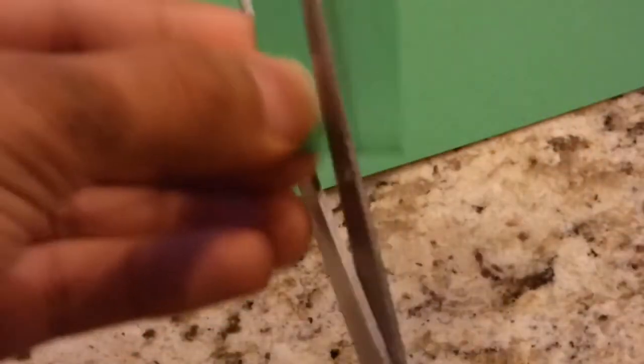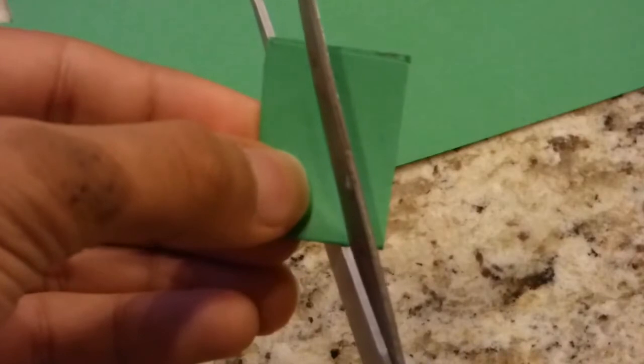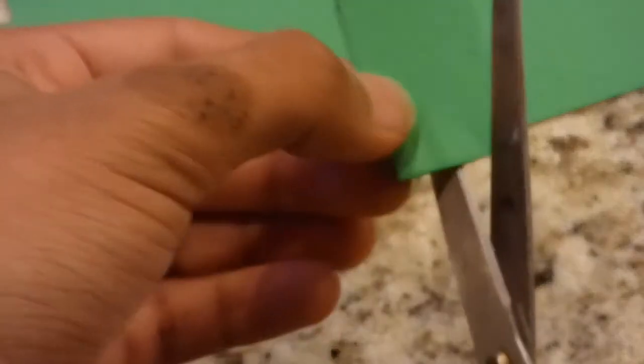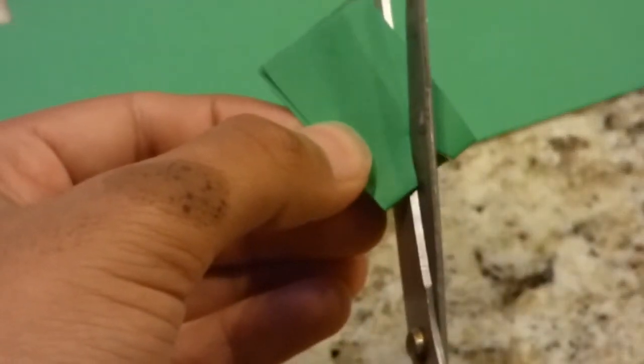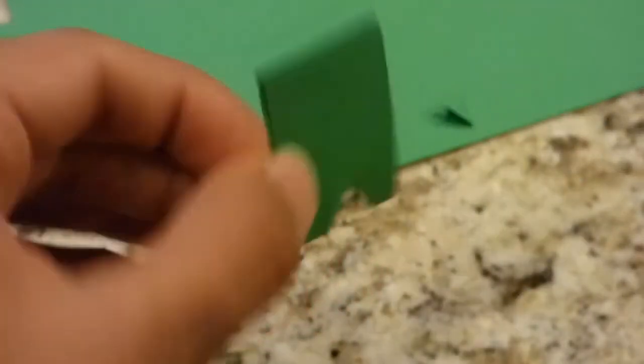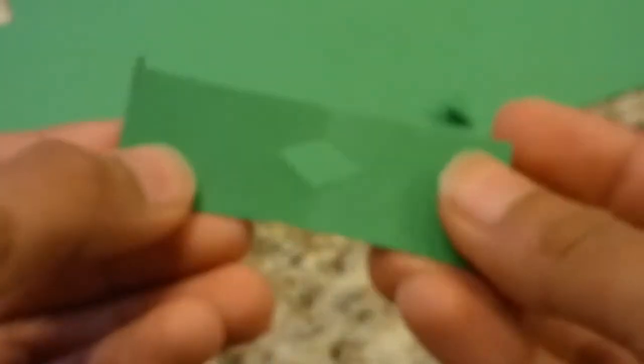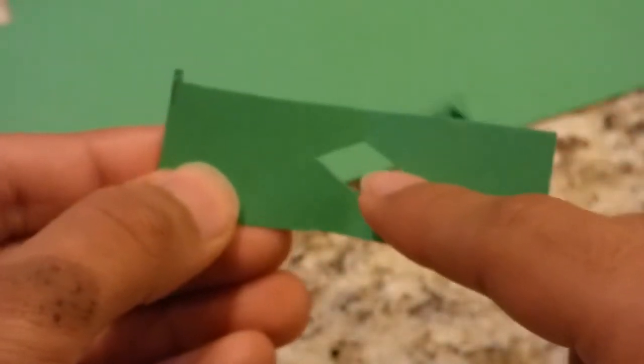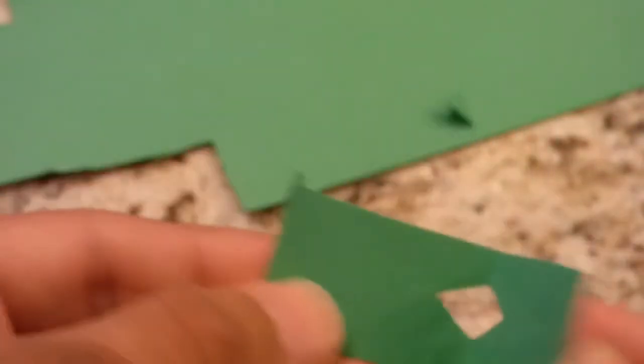Use your scissors to cut out a small triangle on the edge of the rectangle piece. With an ample area to create a hole, you can now tape your sample.